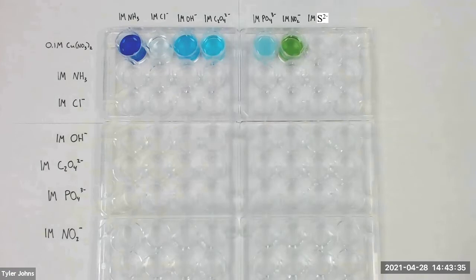To establish the relative stabilities of the seven species, we need to mix them with each of the other species in a systematic way. We will first test them against ammonia.